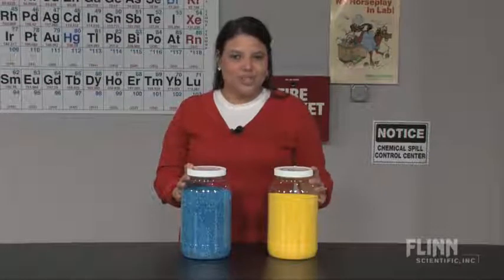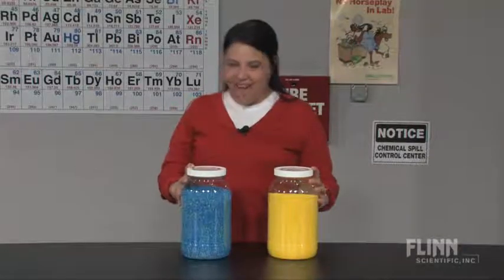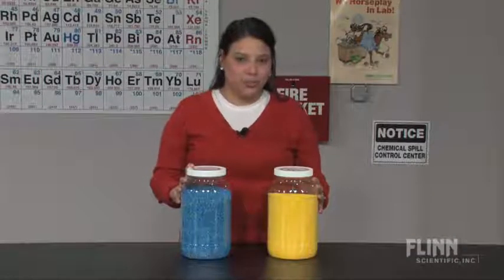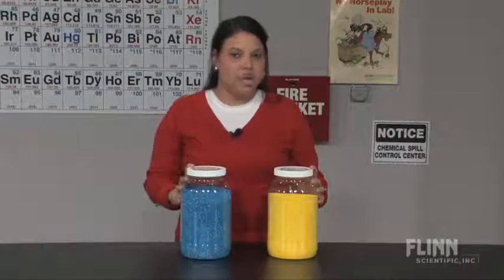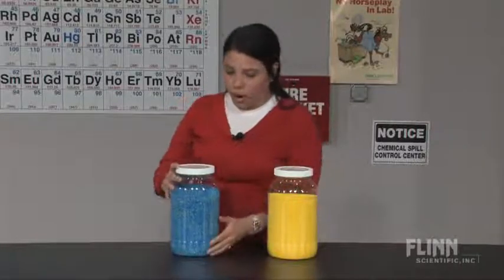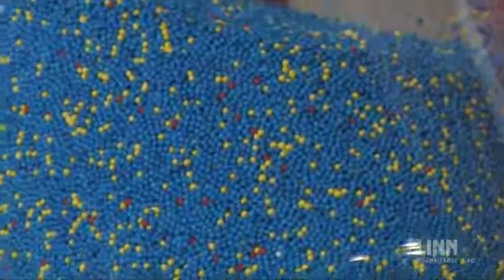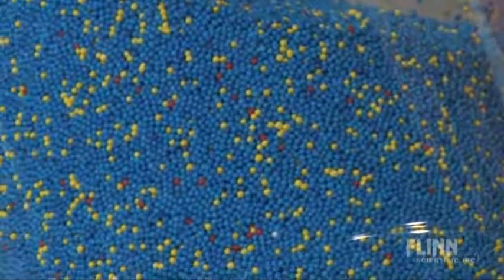Help your students out with the Becker Bottle One in a Million and the Becker Bottle One in a Million Two. These models are excellent teaching tools because they specifically show your students what a hundred thousand parts per million looks like, a hundred parts per million, or even what one part per million looks like.